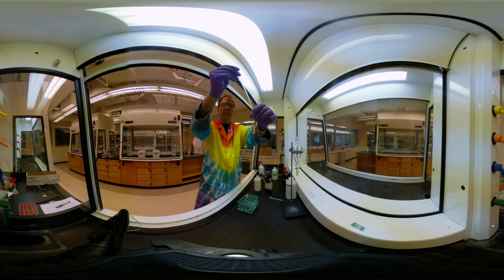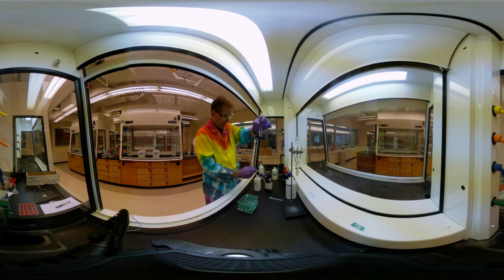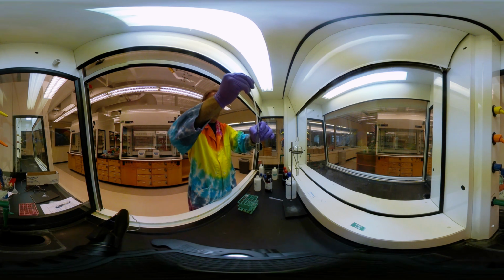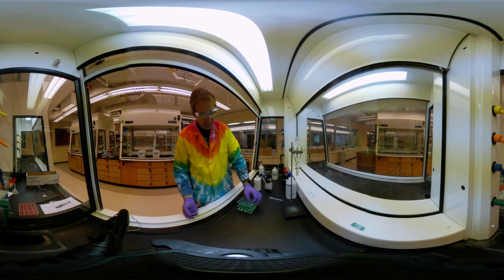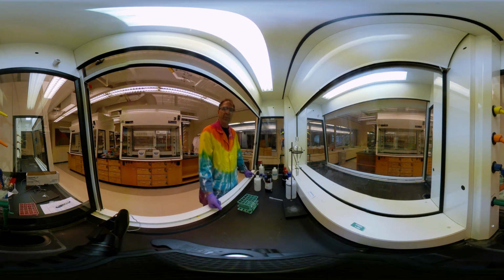Hopefully you can see the bottom layer starting to form there. I'll get out of the way in case that makes it a little easier to see. Once again, we'll confirm that it's the bottom layer by adding a little bit extra. Yep, we definitely have 2 layers, and the bottom layer there was the aqueous layer again. So we did that just to make sure that when we start using our acids and bases later on, they don't affect which layer is which. Okay, that ends part 1.